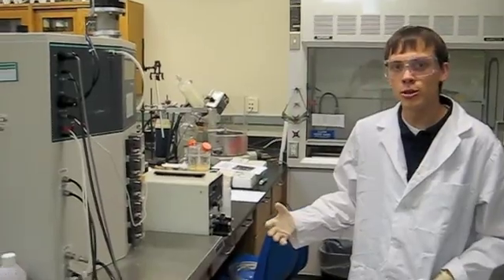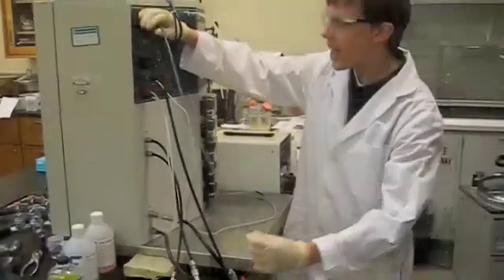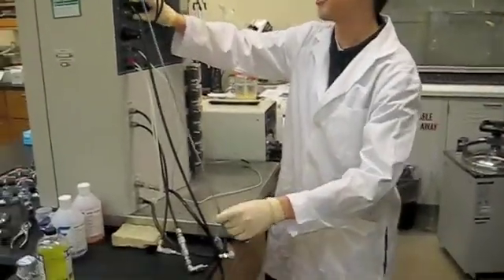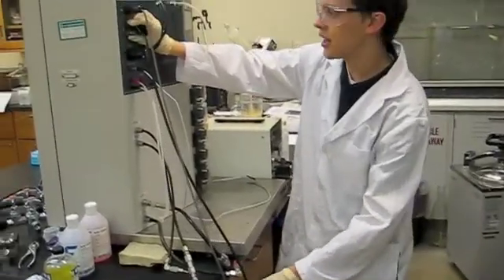So real quick, I'm going to run through some of the connectors. Starting from the top, we have our sparger gas out, we have our DO connector, our DO probe, then the next two ports are pH for the pH probe.